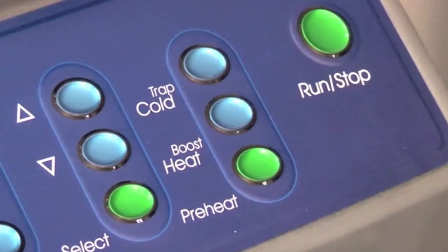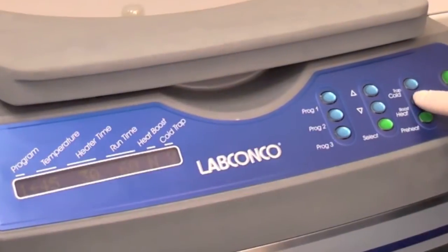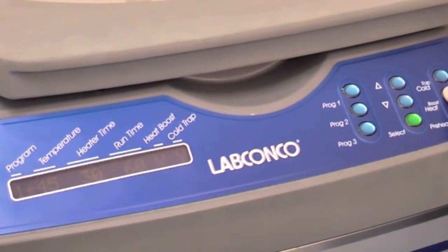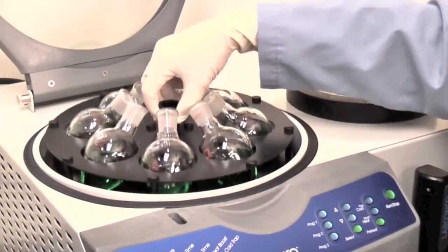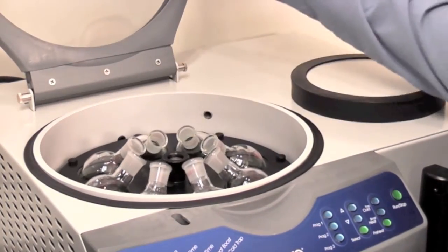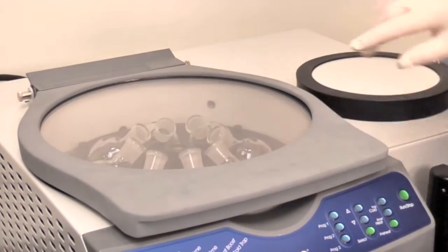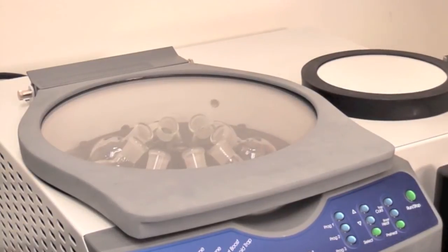If optional heat boost is used, press the heat boost button. Load your samples. Press run stop or program 1.